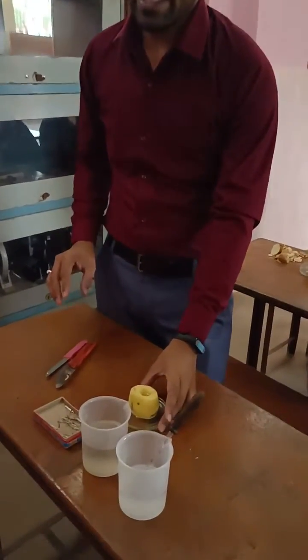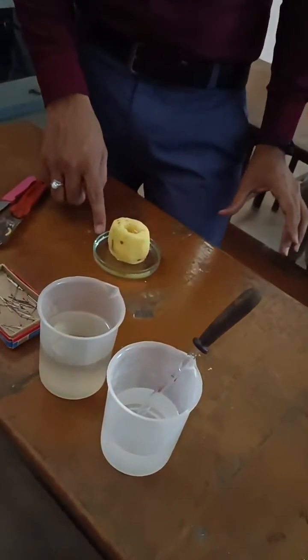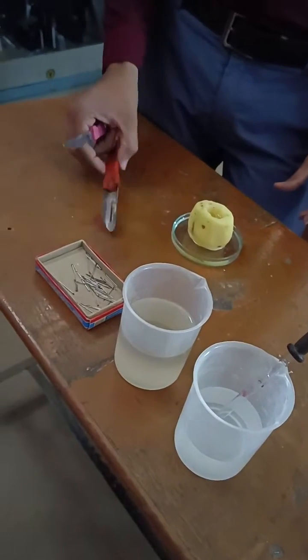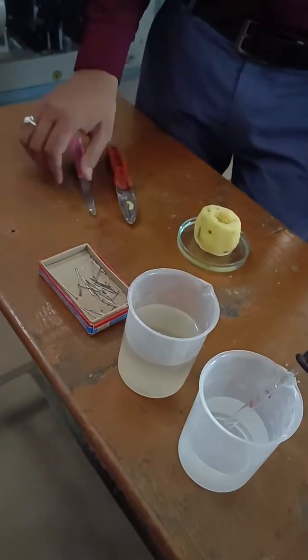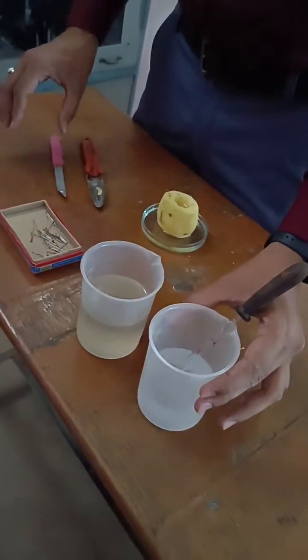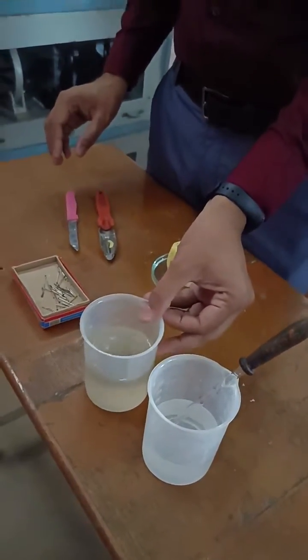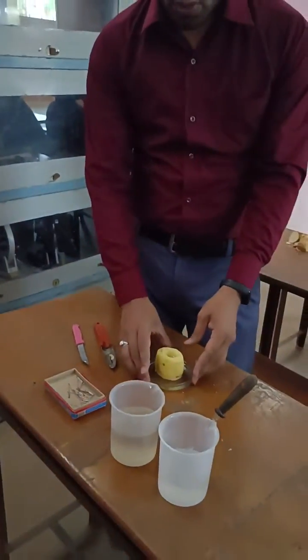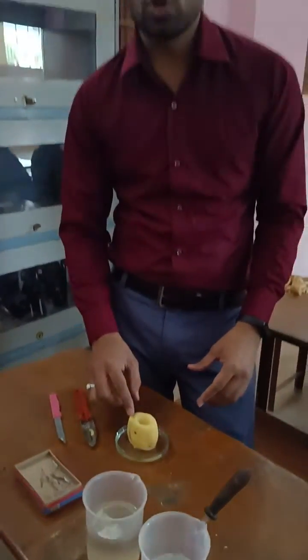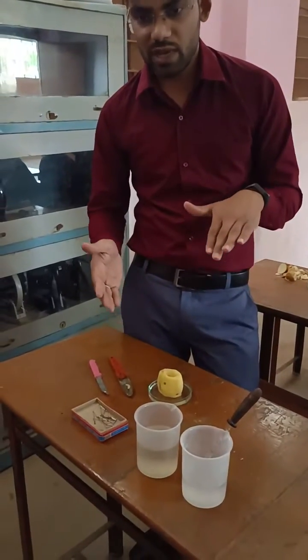For this activity we need a potato, a petri dish, a knife, a peeler, all-pins, water, a dropper, and sugar solution.